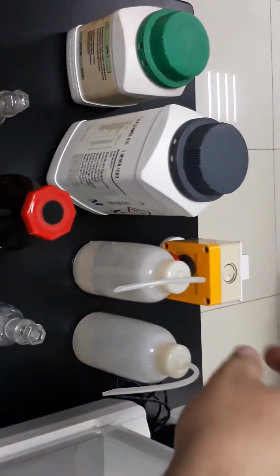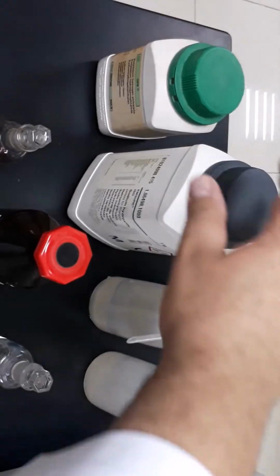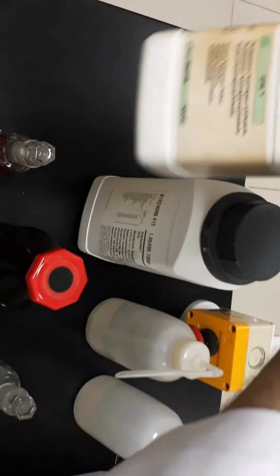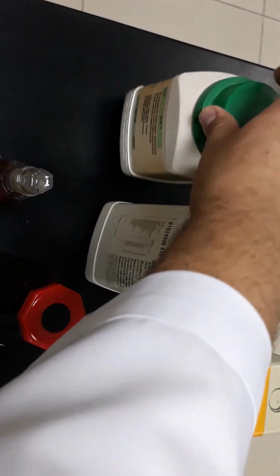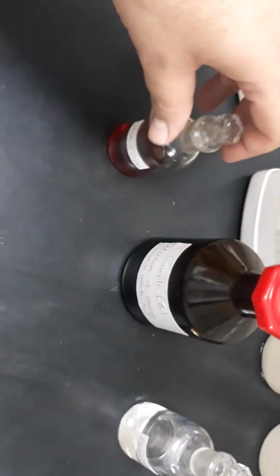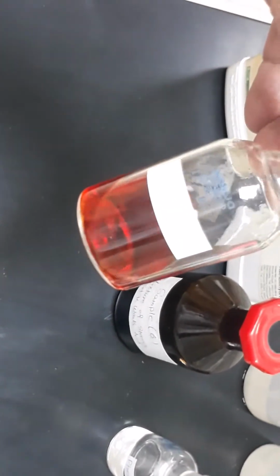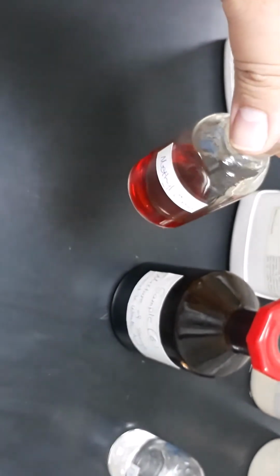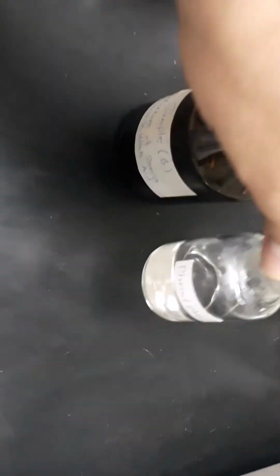in addition to the analytical balance, the water dispenser, and the chemicals we need, which are sodium hydroxide and potassium hydrogen phthalate, in addition to the sample solution, which is a mixture of the acids, and methyl orange indicator. I'm not sure if you can see it well because of the light reflection, but yeah, now it's clear, methyl orange. And this one is the phenolphthalein indicator.